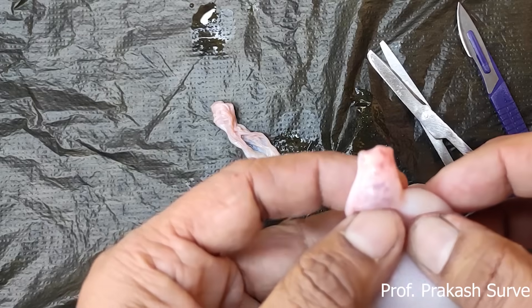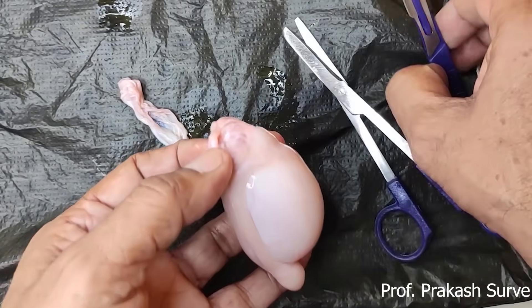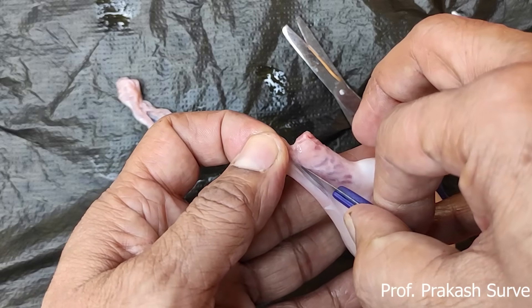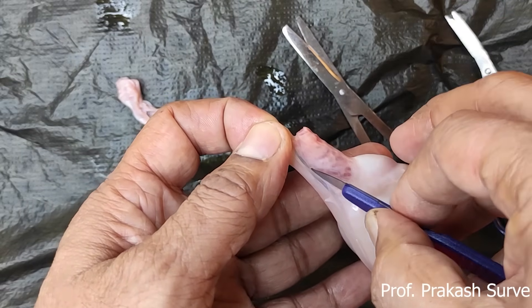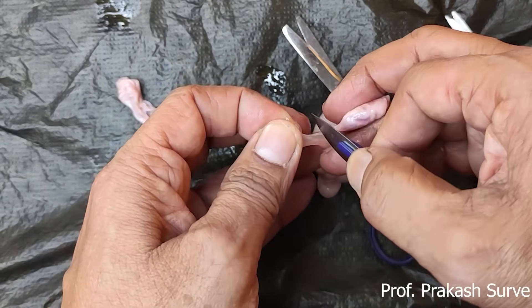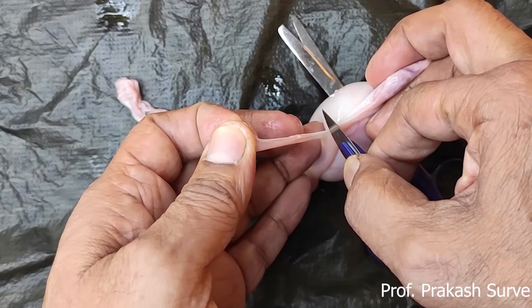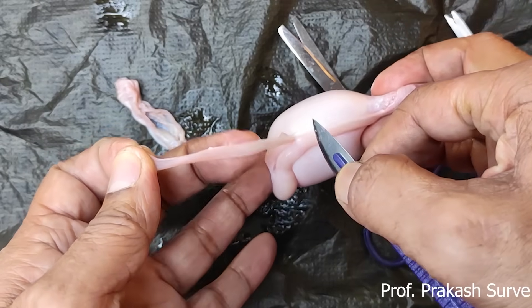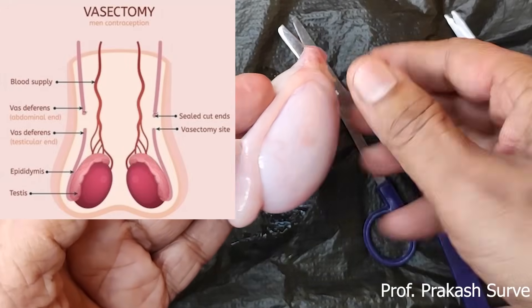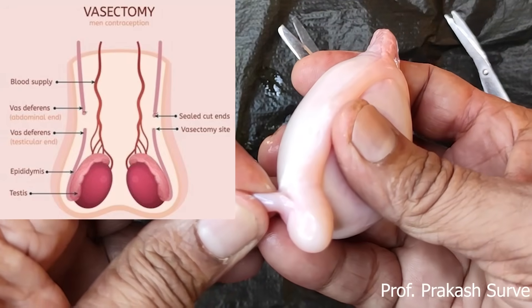Here the epididymis is there. On the top we find the head of the epididymis. I am removing the vas deferens first. The function of the vas deferens is to carry the sperm and pass it to the urethra. In the case of human beings, for birth control, the vasectomy process is used, in which the vas deferens is tied and cut, which blocks the transport of gametes.